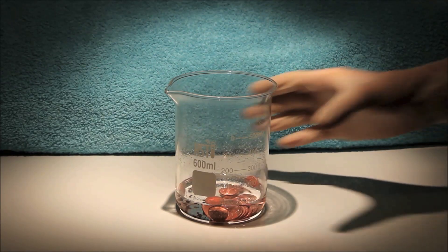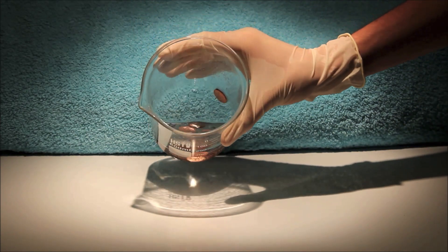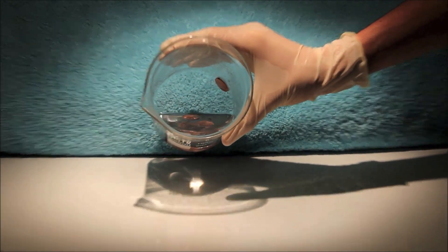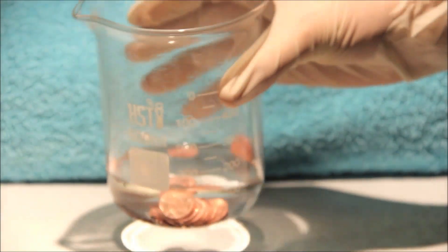You will know that the reaction has completed due to the absence of bubbles. Here no more bubbles are forming. Also, a few of the pennies are floating, indicating that they are hollow.